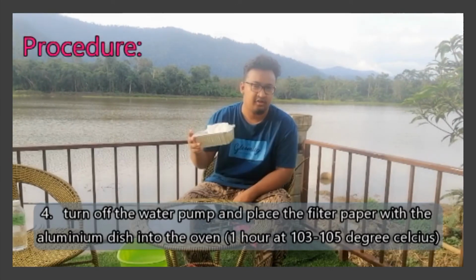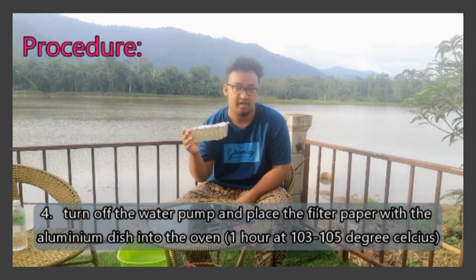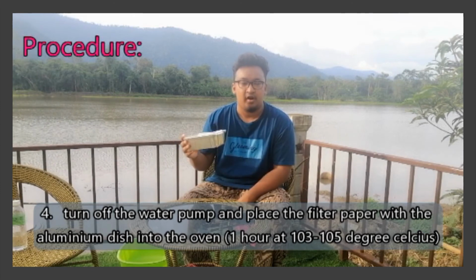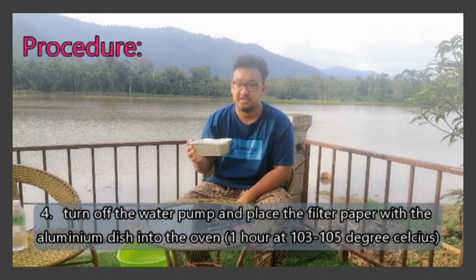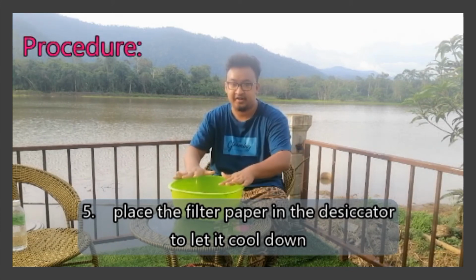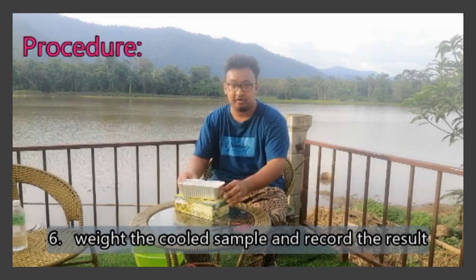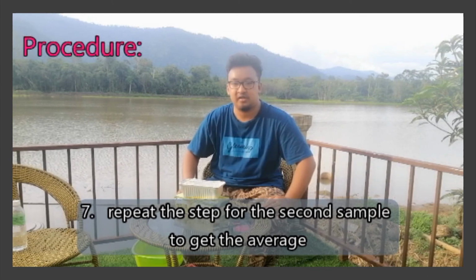Next, turn off the pump and place the filter paper with the disposable aluminium dish into an oven for 1 hour at 103 to 105 degrees Celsius. After heating the sample, we place it in the desiccator and cover it to let it cool down. We measure the weight again and record the result. Repeat the steps for another sample to get the average.